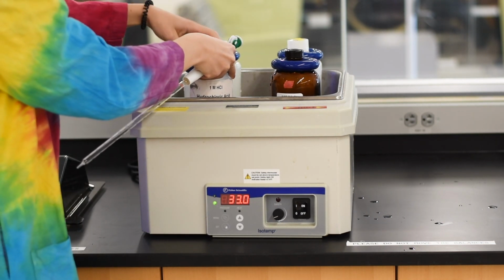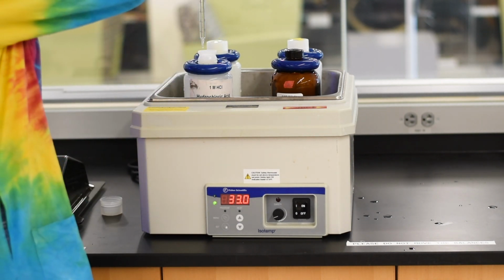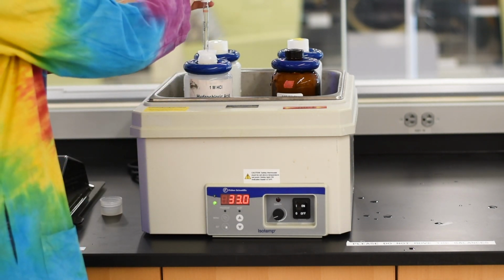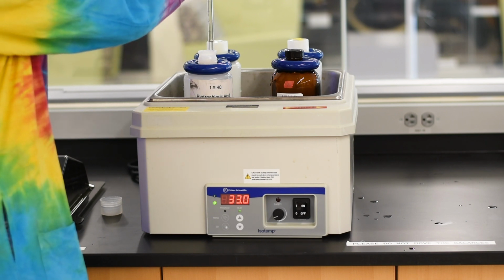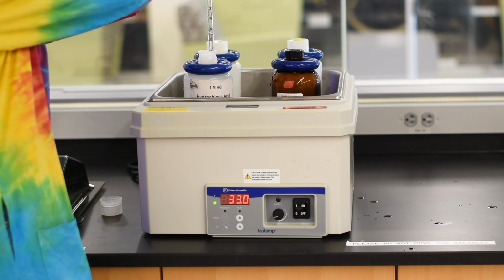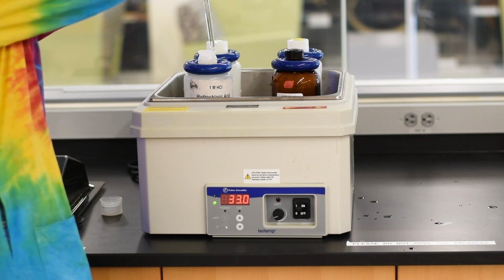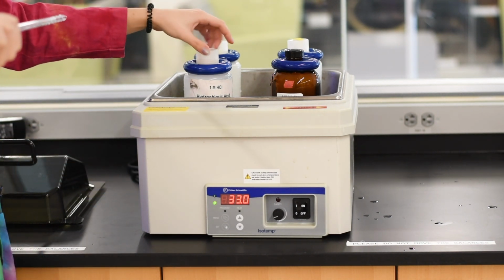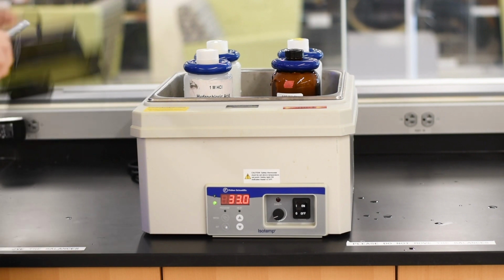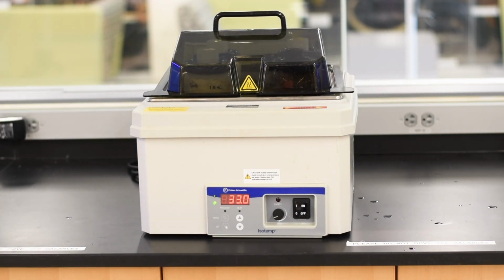Now, when Devin and Patricia were taking the solutions out of here, they did make a little mistake with the pipette that I did notice when I was editing this together. When transporting the pipette, you do not turn the pipette upside down. Look at that right there. Don't do that. You want to make sure that the tip of that pipette is always down when you are carrying it. Just a little mistake I noticed, but don't worry about it.